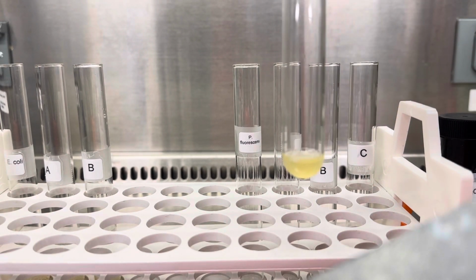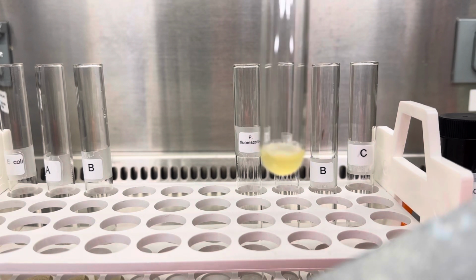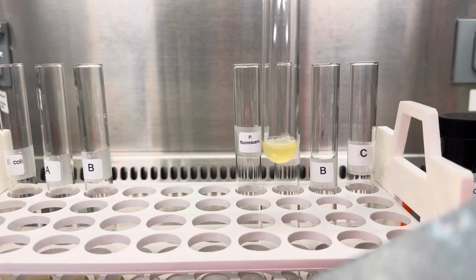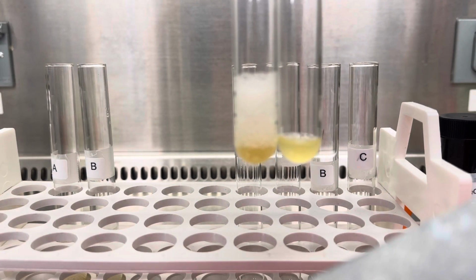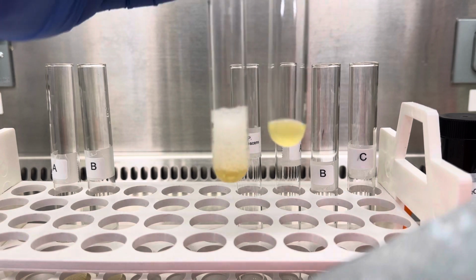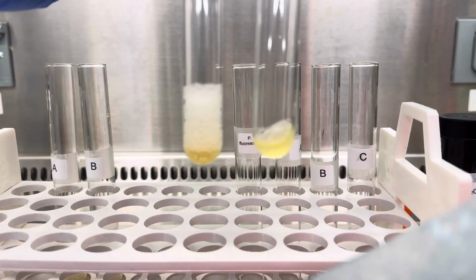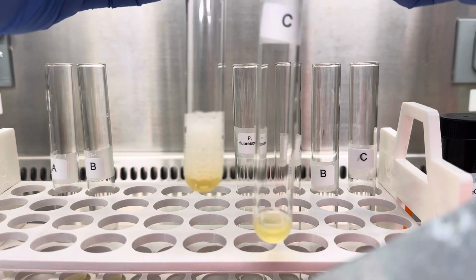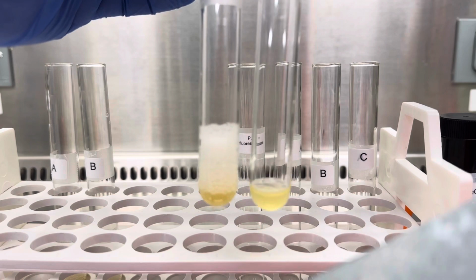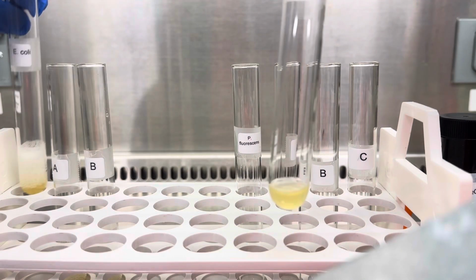This one, guys, I don't really see much bubbles forming at all compared to, let's say, the positive control. You can see the difference, right? There's a lot of oxygen in the first tube, in the positive, and then in the unknown C, there's absolutely no catalase activity, meaning that this particular bacterium that we don't know what it is doesn't really express any of the enzyme catalase, okay?